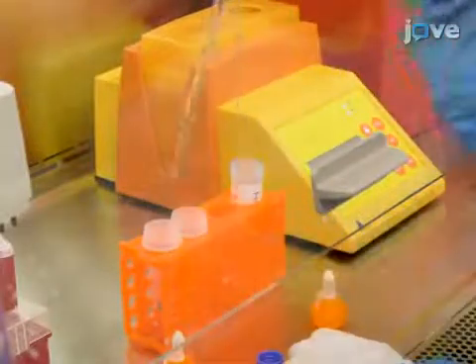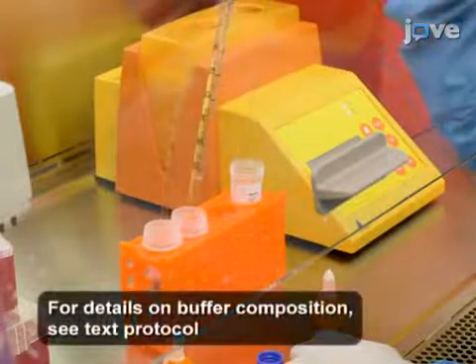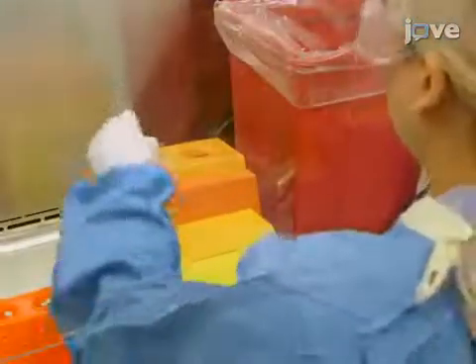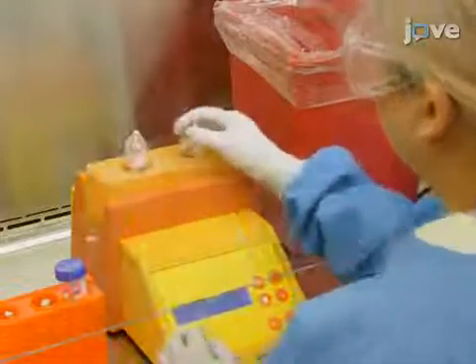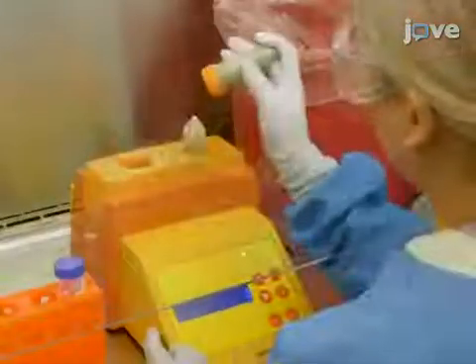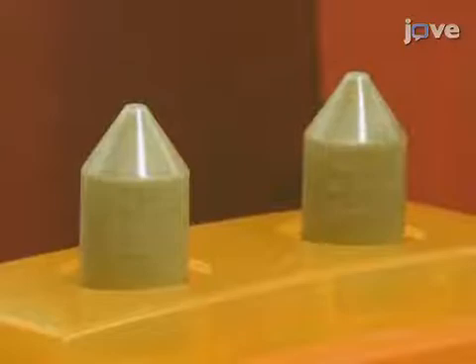To begin this procedure, add one gram of fecal material to a tube containing 10 milliliters feces extract buffer. Using a dissociator with a preset program for proteins, homogenize the fecal pellets for one minute at room temperature. Repeat this two to three times until the fecal samples are completely homogenized.